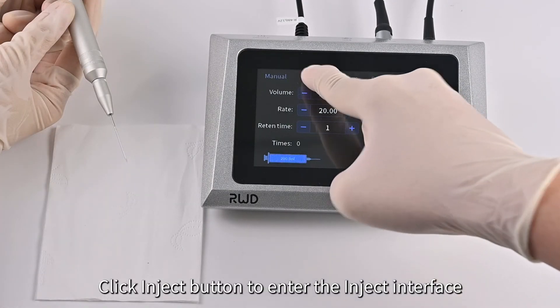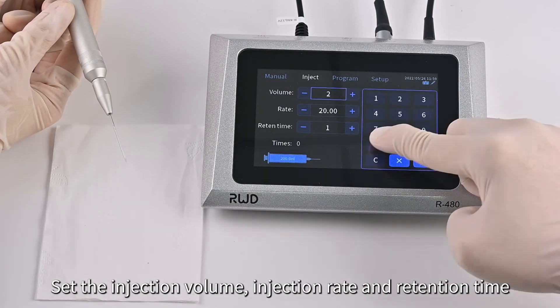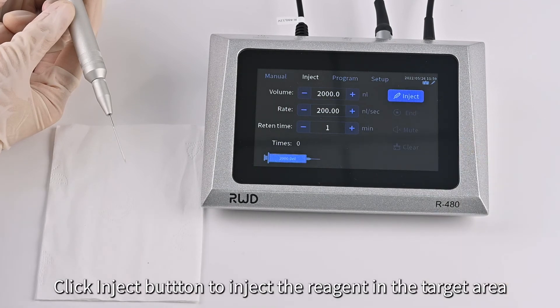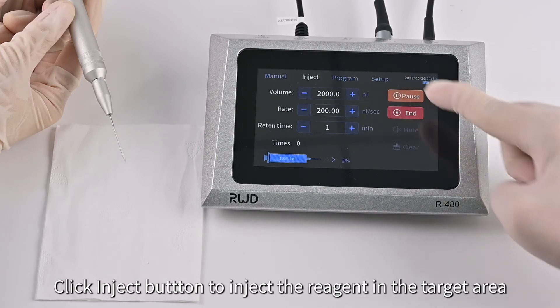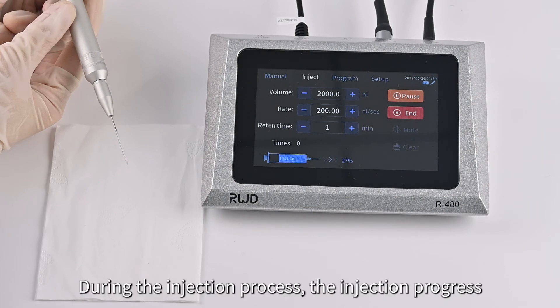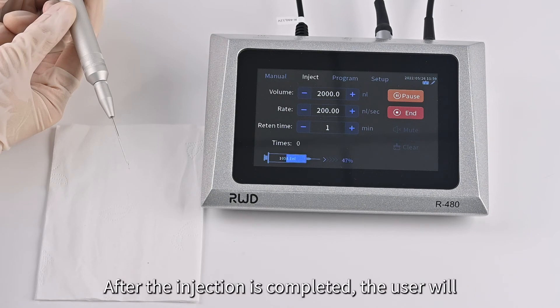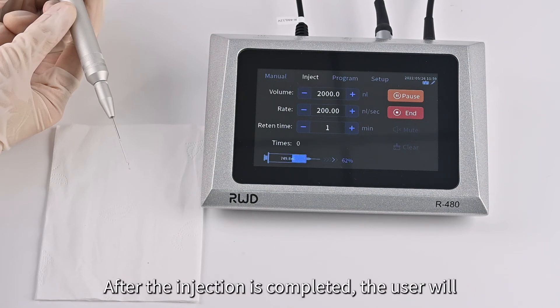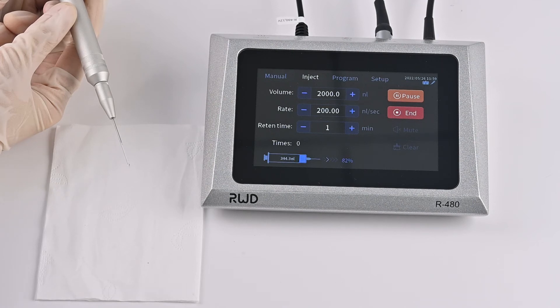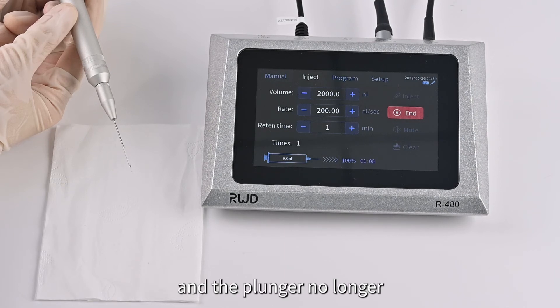Click the Inject button to enter the inject interface. Set the injection volume, injection rate, and retention time. Click the Inject button to inject the reagent into the target area. During the injection process, the injection progress is displayed in real-time. After the injection is completed, a beep will be heard and the progress percentage will show 100%. If the retention time is not zero, enter the retention period, during which the plunger no longer moves.